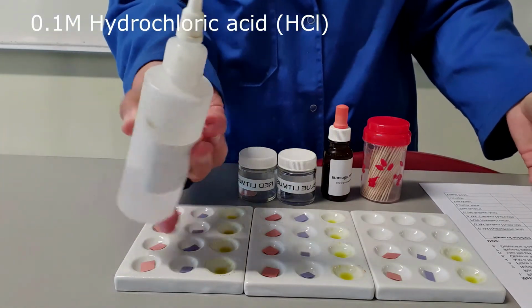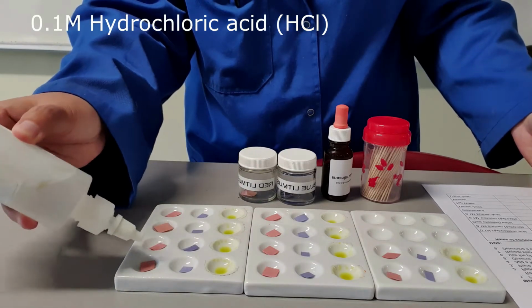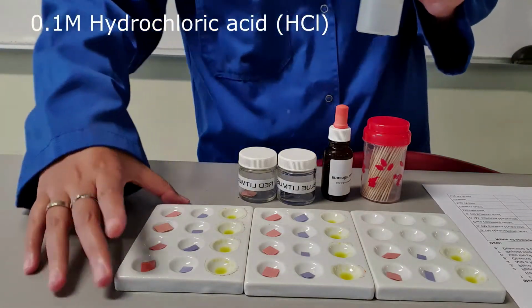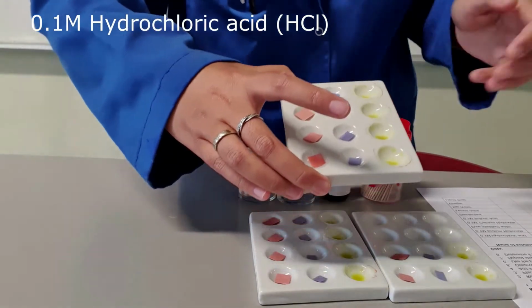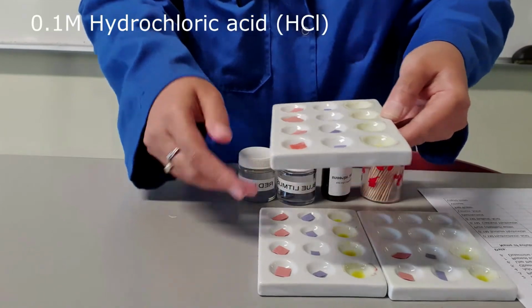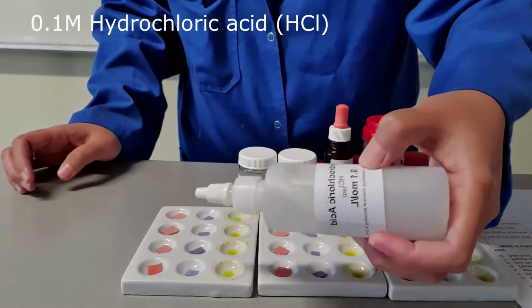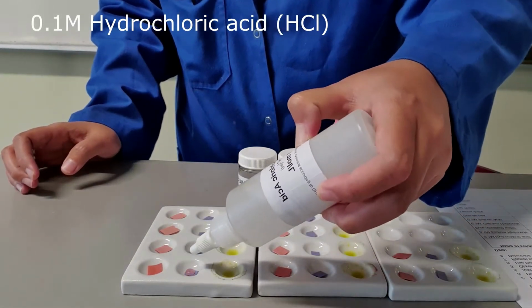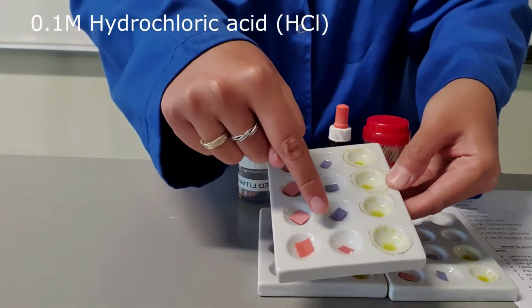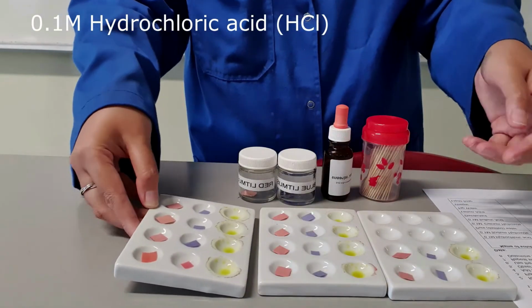Okay, so I will drop the hydrochloric acid onto the red litmus paper and we see the changes, if any. Okay, so as you can see here, there isn't any change that takes place. The red litmus paper stays red. Now what happens if we put some hydrochloric acid onto the blue litmus paper? Okay, so immediately the blue litmus paper turns red. So that confirms that hydrochloric acid is, of course, an acid.